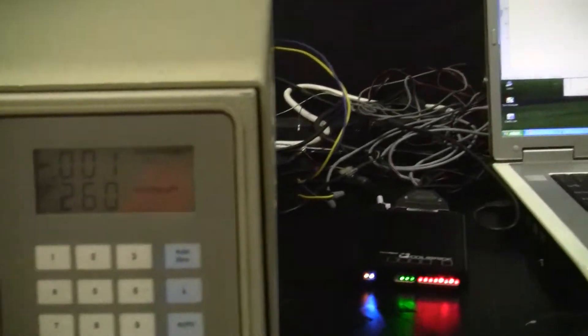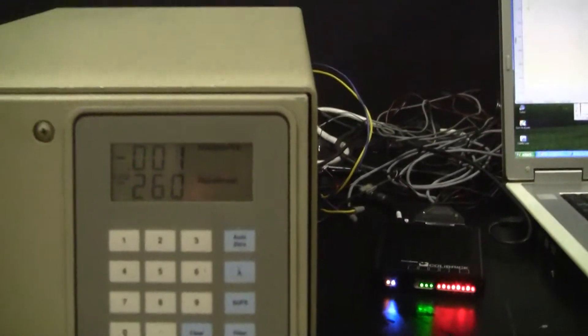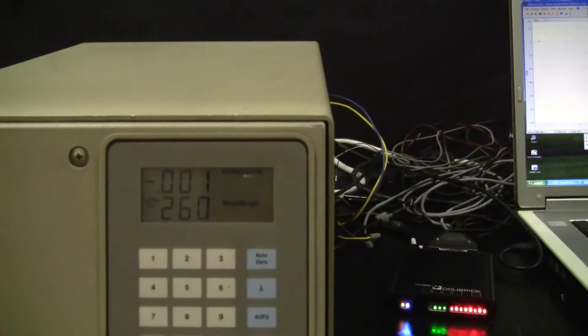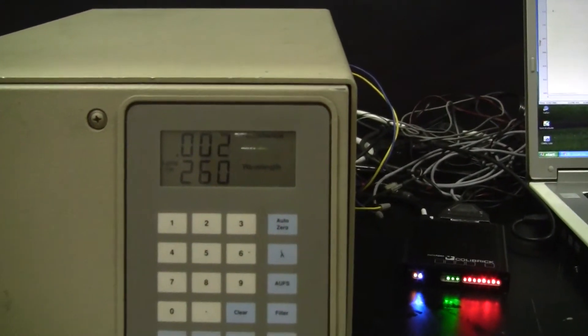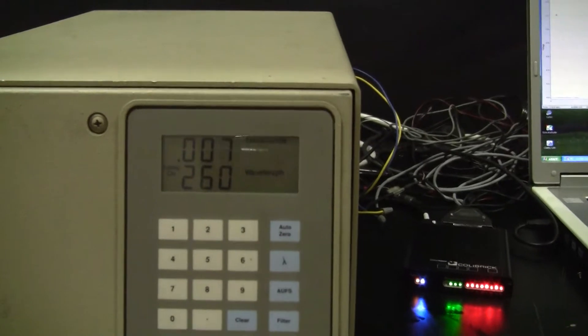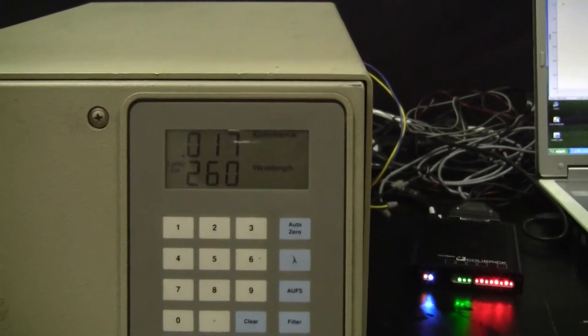Hopefully in just a few moments we're going to be looking for a peak. And there it is.